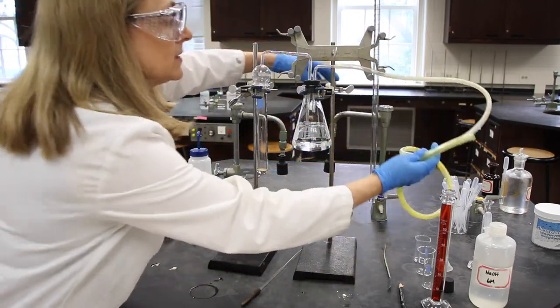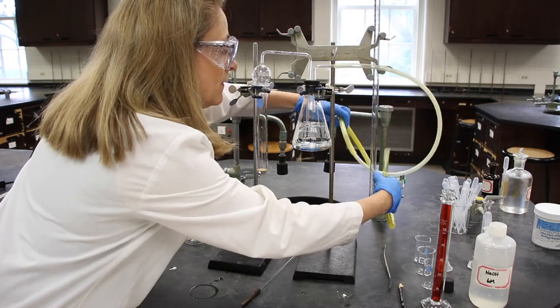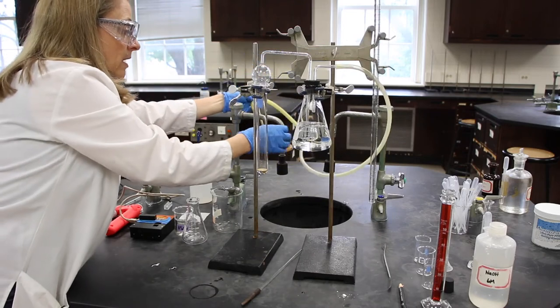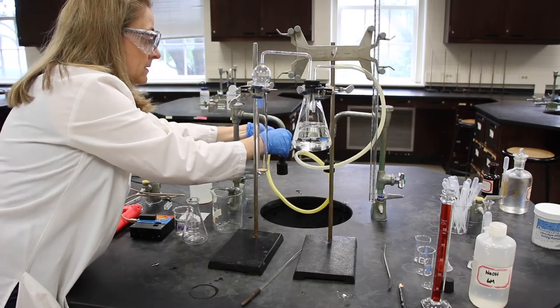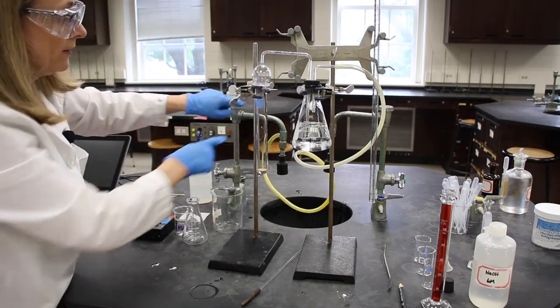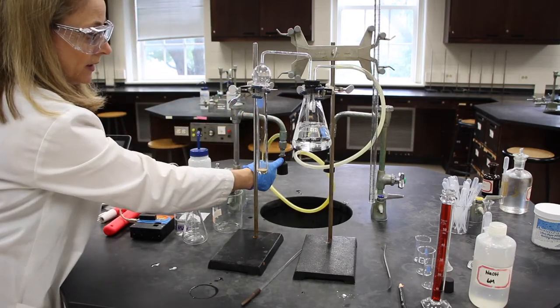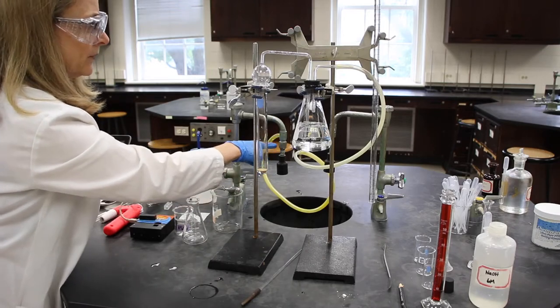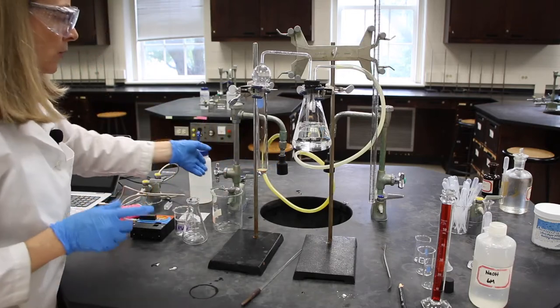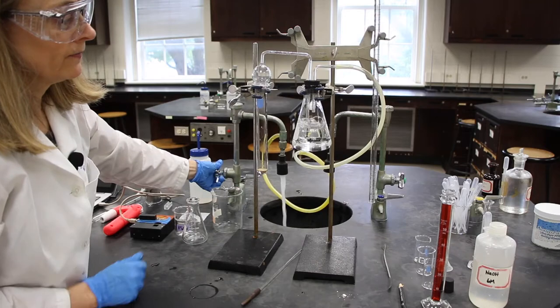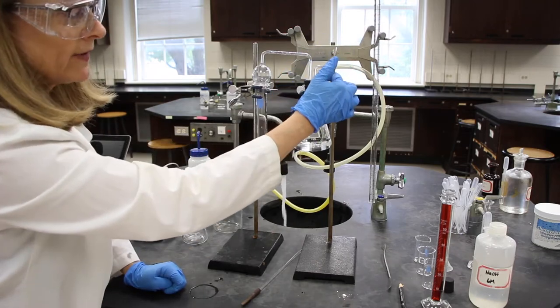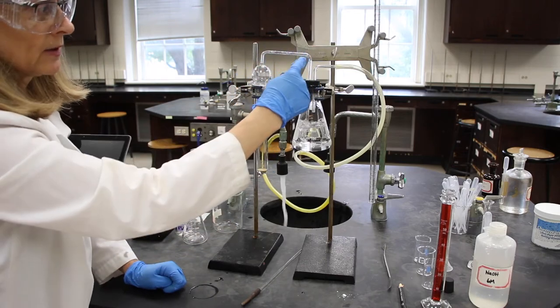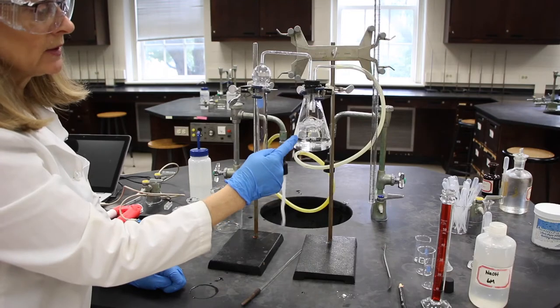And how we're going to do this, this is based on Bernoulli's principle. There's a small side arm on the water delivery here. And when water flows over the arm, it's kind of on the back. I'm sorry, you cannot see it very well. It will create a vacuum. And we're just going to turn that on. And if you see bubbling, you know there's a vacuum created. And it's pulling any toxic gas through into the solution to get neutralized.